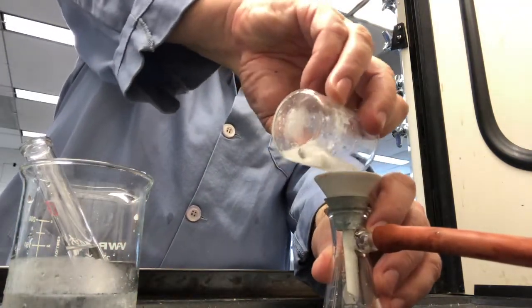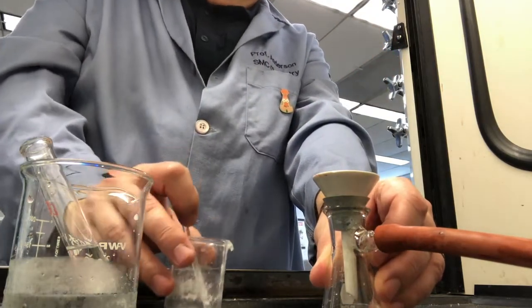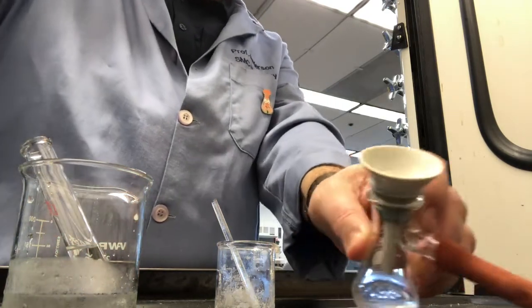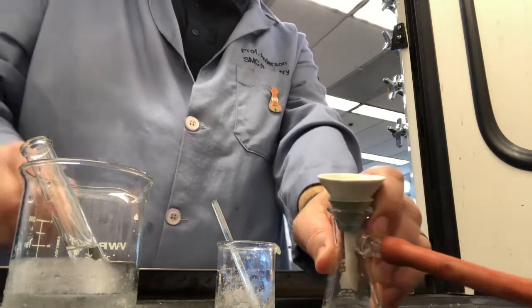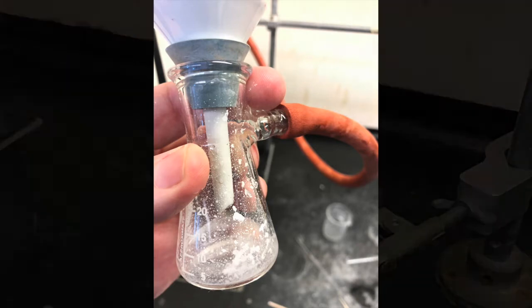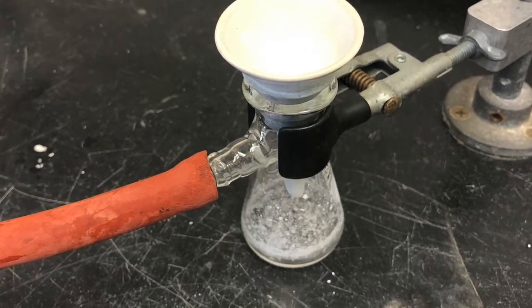I put the ether into the flask now. You add 1 milliliter of ether and pour it over the crystals to make sure that they are rinsed thoroughly with the ether. This helps to remove the benzoic acid byproduct that forms. And here you can see the rinsed crystals, fluffy white powder. You can see some after evaporation, there was some solid left in the filter flask. Presumably that would be benzoic acid.